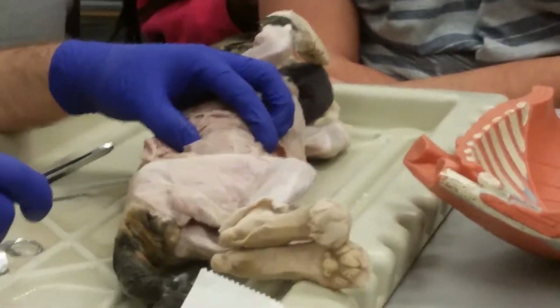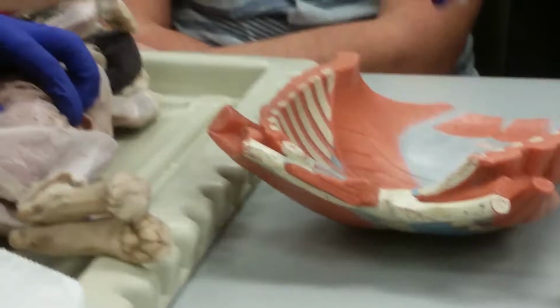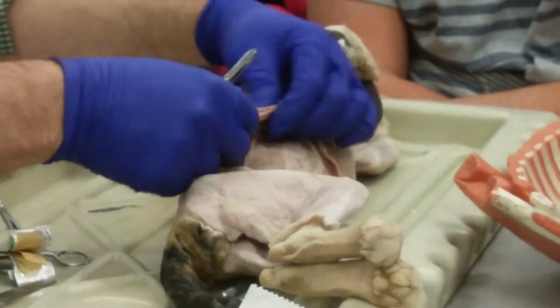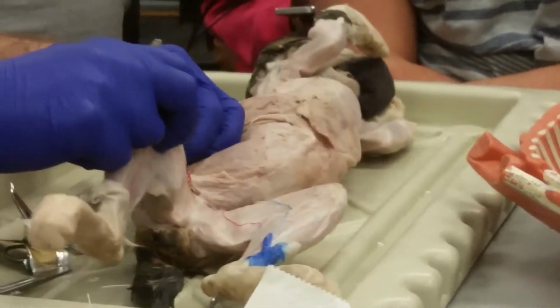Right? So it's going straight across, like a cummerbund there. So it has no leverage. It goes from fascia on one side to fascia on the other, and inserts into the vertebrae. So it doesn't cross any movable joint. So all it can do is compress the abdomen. Okay? Transversus abdominis. Okay, so this is not the best cat for the abdominals because of this sort of weirdness here. Some of the other ones look a little better.